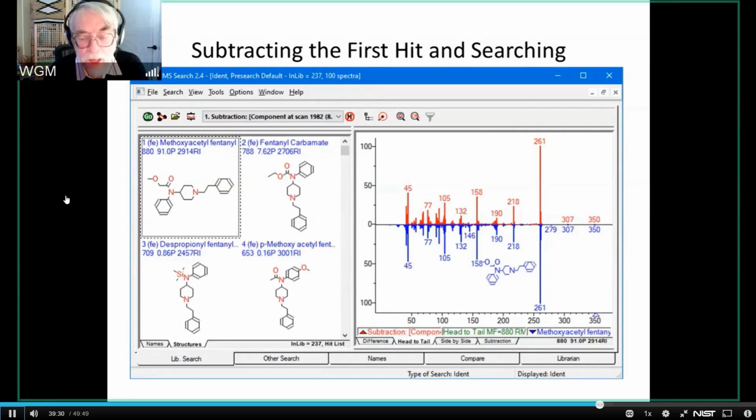That is to say, we've taken a complex spectrum, we have searched it, we've taken what looked like the best hit, and we have subtracted that, and then we've searched that again, and then we have taken the thing that resulted from that, which in this case happened to be the methoxyacetylfentanyl, and we've subtracted that from the data and searched it, and we've basically closed the loop, and we've said that it's reasonable to assume that the spectrum that we saw is composed of two components.